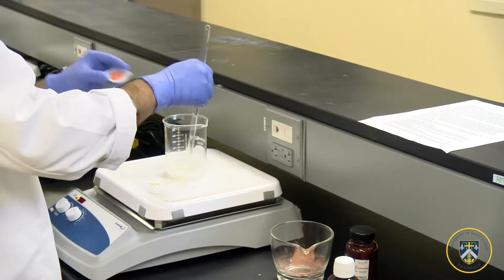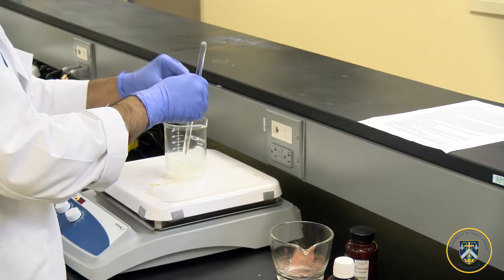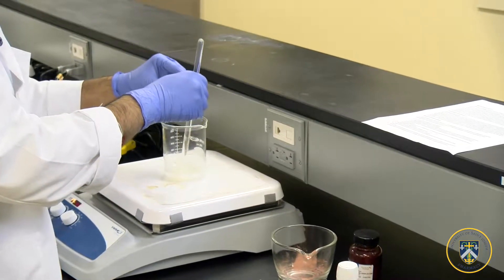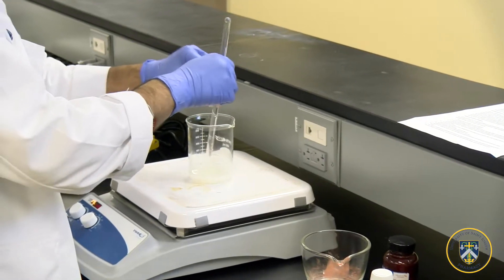As your sorbitol base has melted, you can add your Nystatin lactose monohydrate powder in here slowly to ensure even mixture.